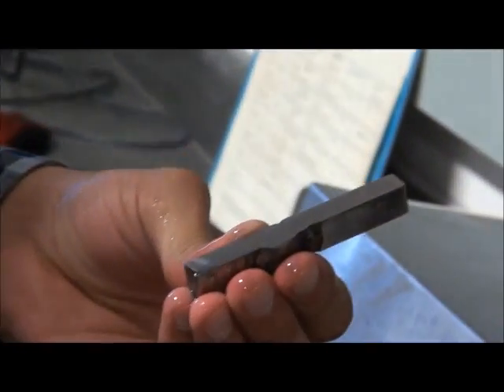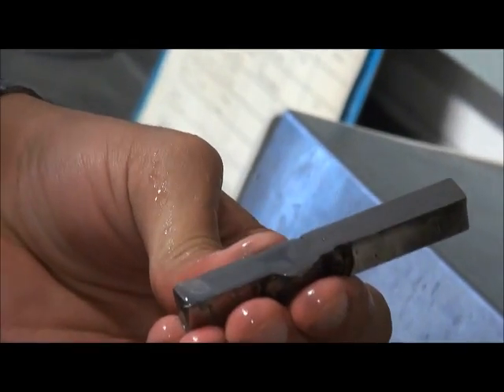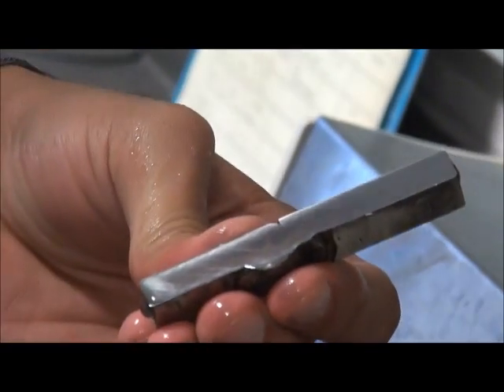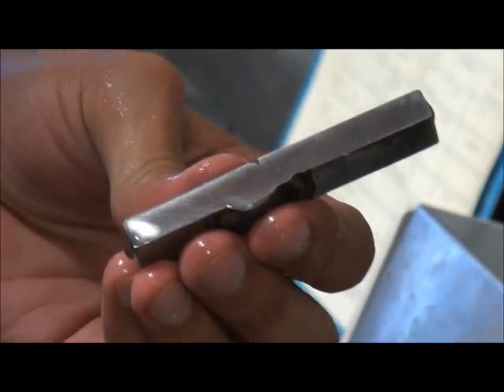So, we were there for the last coarse paper grinding. So now our grinding is done. Now we will go for the polishing board. So now my friend Harpreet will take over the sample and he will do the polishing board.